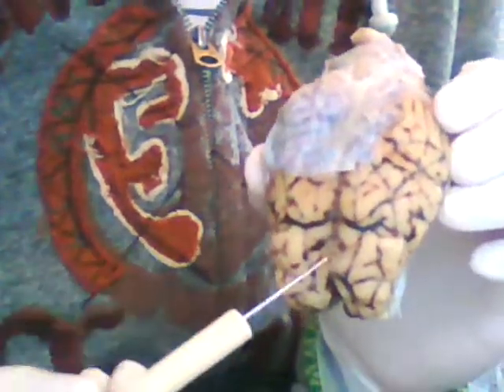Okay. So this is a superior view of the sheep brain. You can see like the white film over here compared to here. I cut most of it off, but I wanted to keep some of it on because it is the dura mater and the arachnoid layer, which keeps cerebrospinal fluid in, and it surrounds the entire brain.